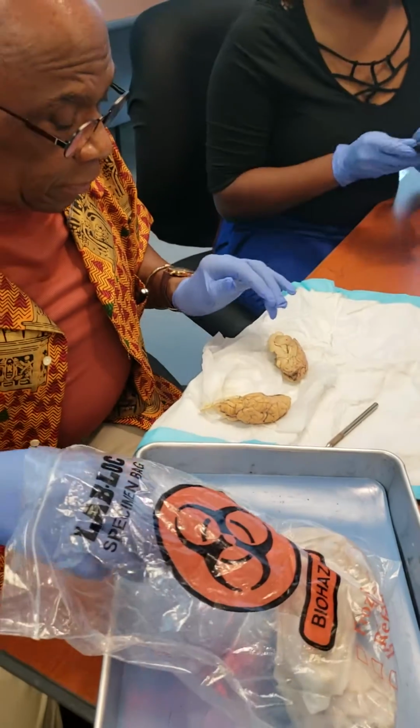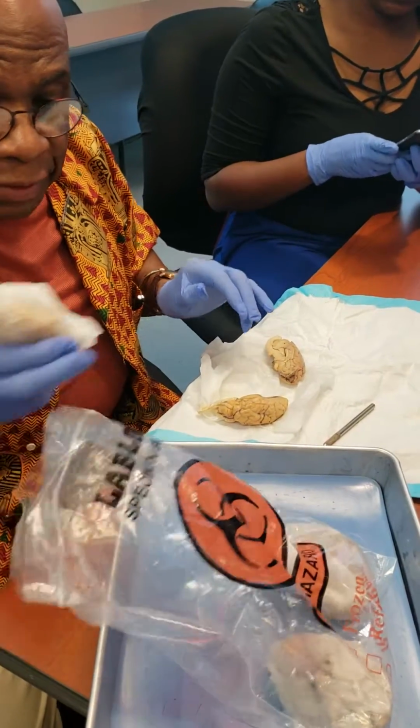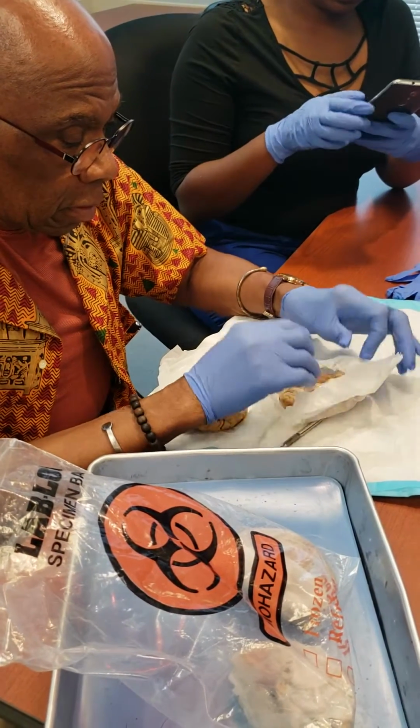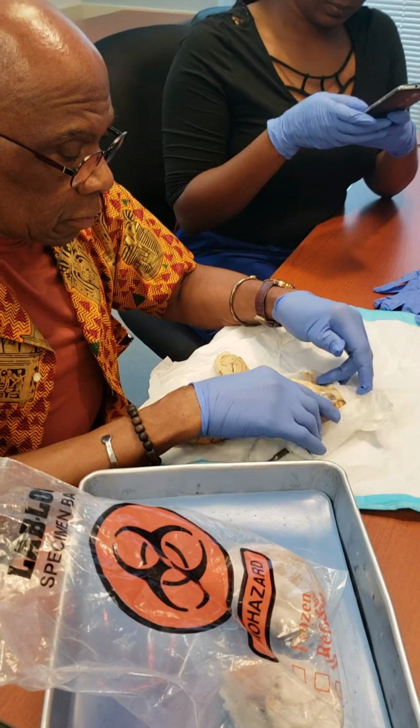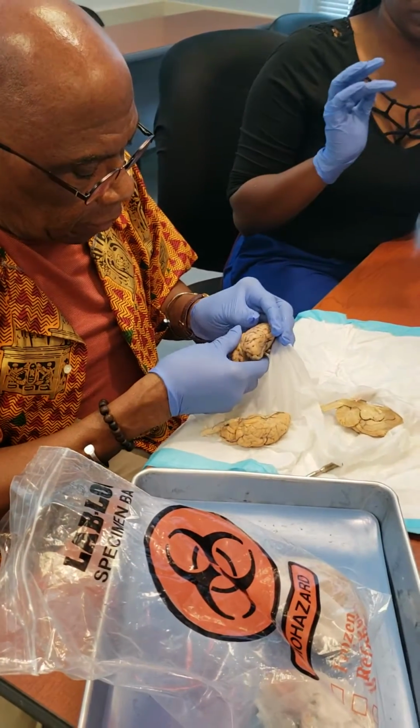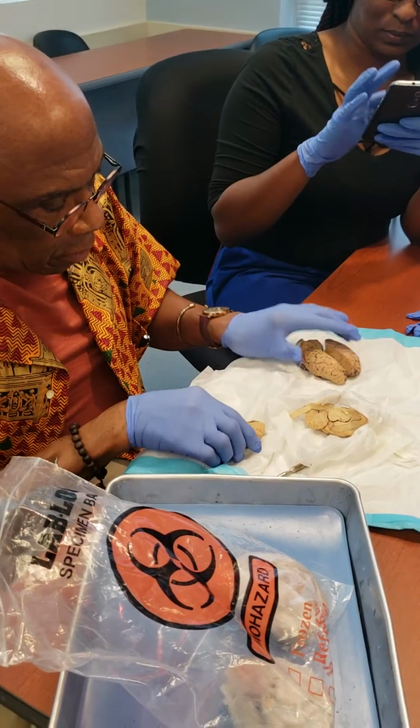You see what the problem is, right? Yeah. You have 2 left brains in here. And let me guess, somebody with 2 right brains, huh? Yeah. Chicken tender. You do look like chicken strip.